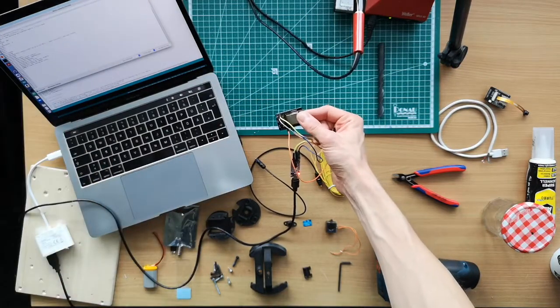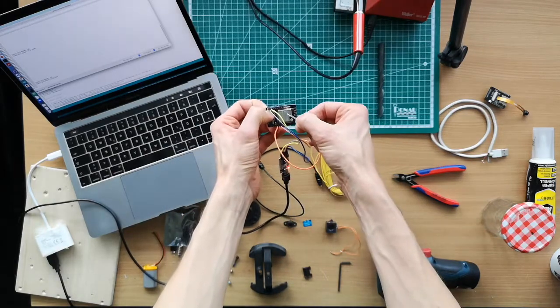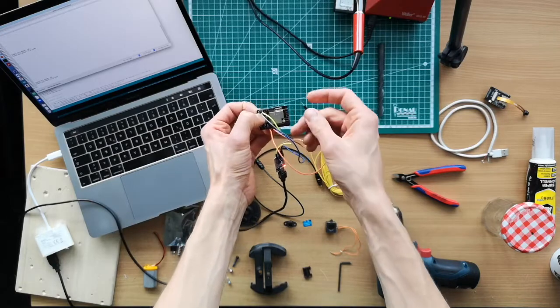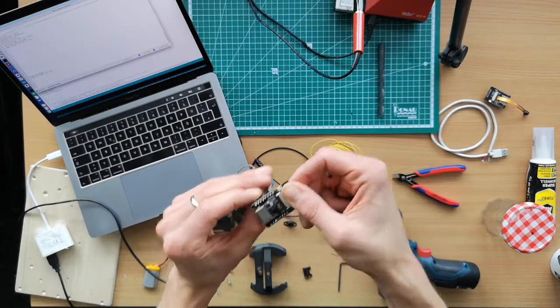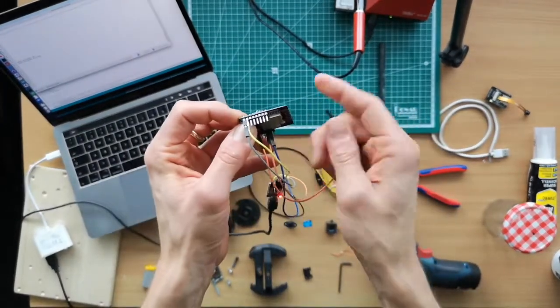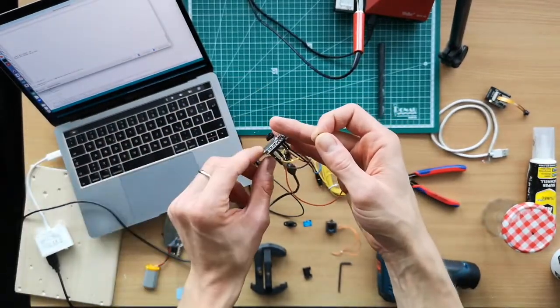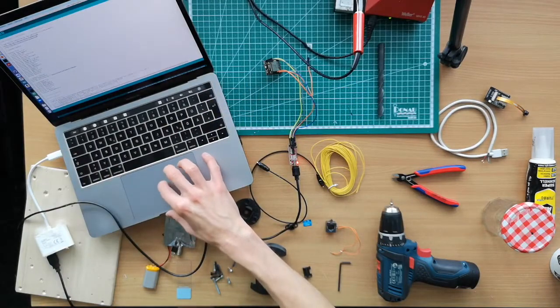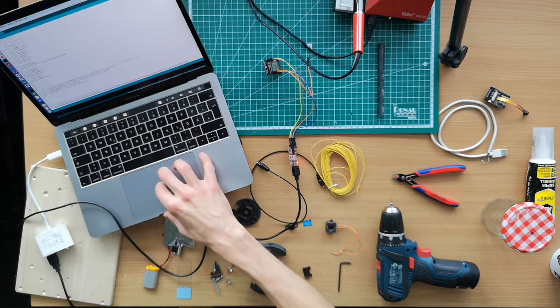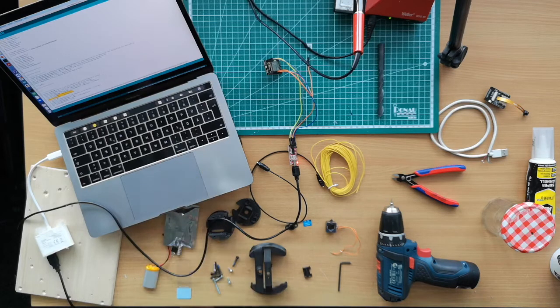So there's already some firmware flashed, but we'll reflash it. So you have to hit the reset button, and then also shortcut the ground pin to the IO0, which is right here. So you have to hold the reset pin, and then, well, this one's also connected to ground. And then on the serial monitor, you see that it says waiting for download. Then you open the flash thing here. Eventually you also have the code, and then maybe you've changed the SSID and the password, and then you hit the upload button. Then it's getting compiled and it loads up. This may take some time, so I would just skip that.